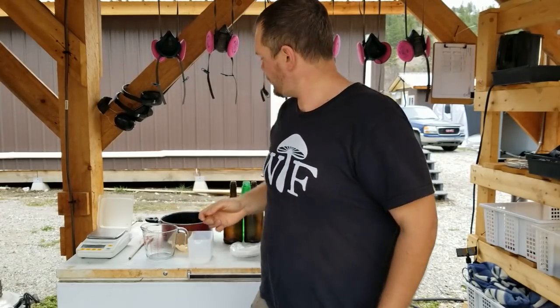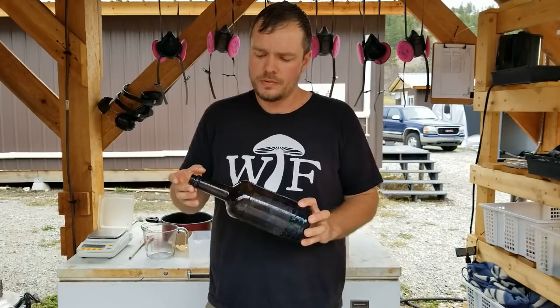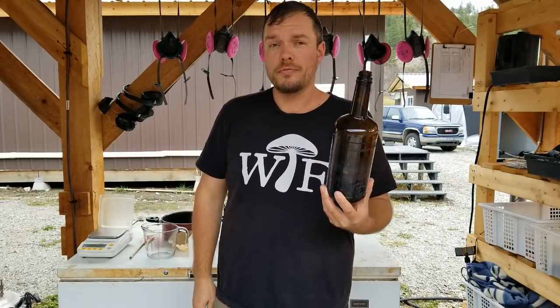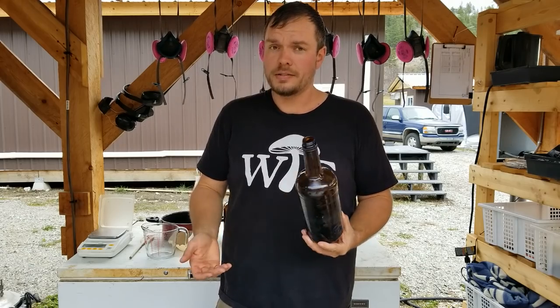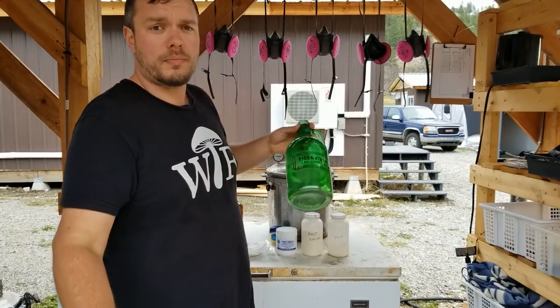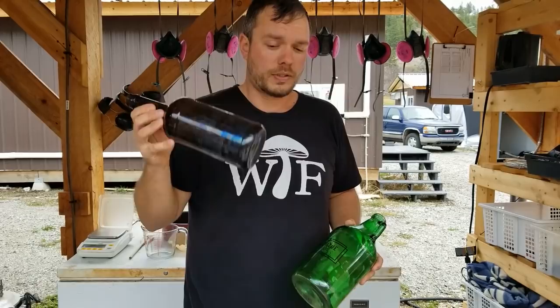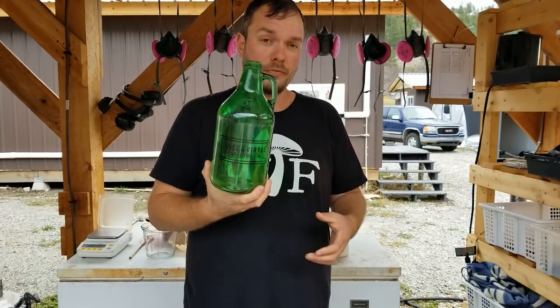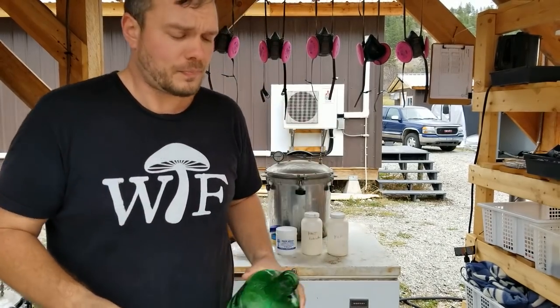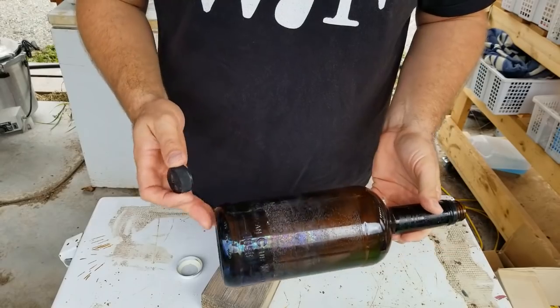I really like to use whiskey bottles. The best thing about using whiskey bottles is you get free whiskey and then you have a perfect agar bottle to use. These are 750 ml bottles and they last a long time. Growler bottles are great too, but the only problem is they often break a little bit quicker than whiskey bottles. Today I'm going to show you how we convert a growler bottle into a perfect agar bottle.